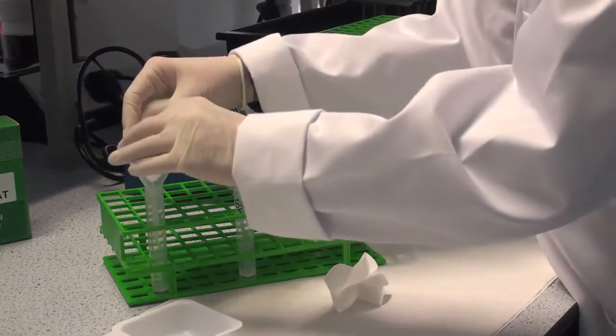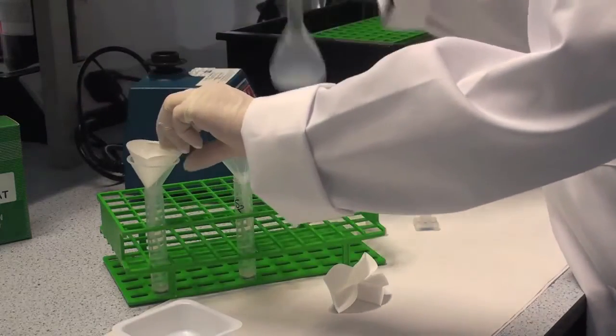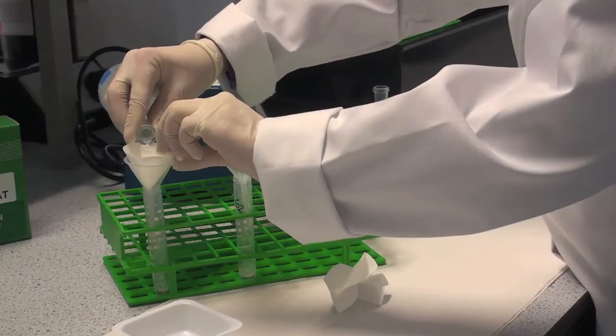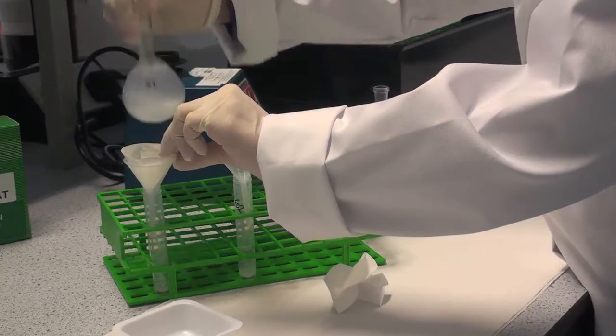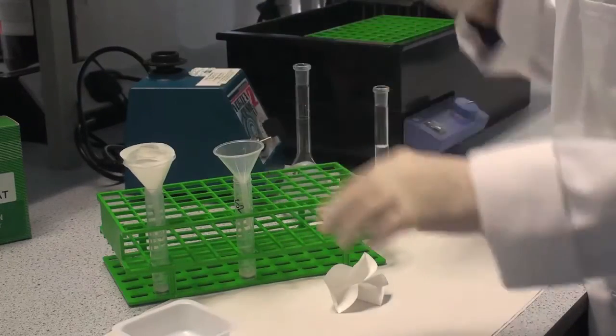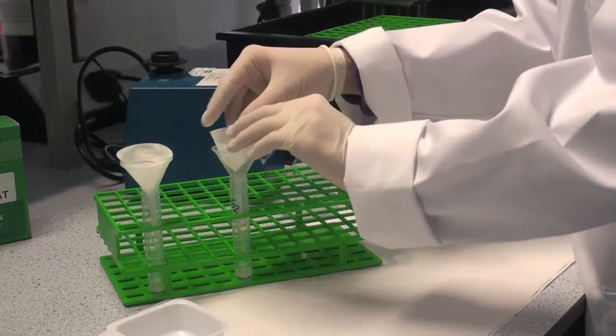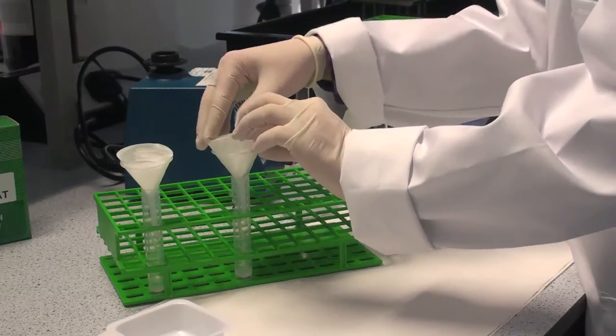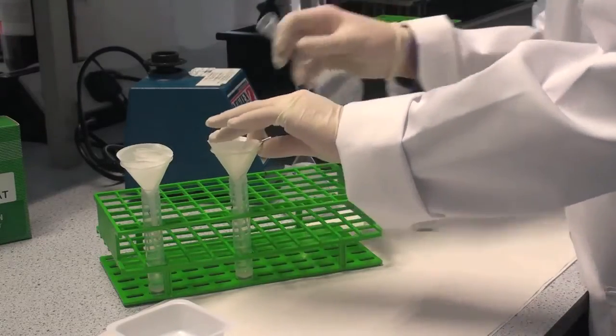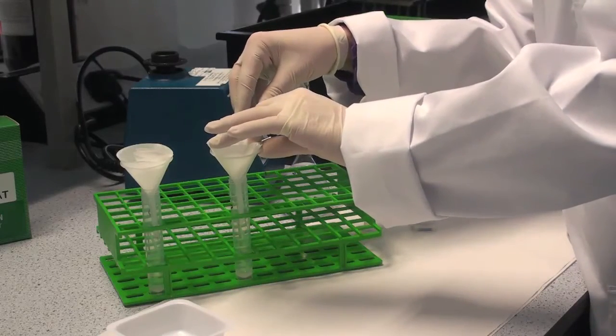Filter an aliquot of the solution through a Whatman No. 1 9 cm filter circle. These solutions should be analyzed immediately. The solutions may be slightly turbid depending on the nature of the sample extracted, but this is not a problem.